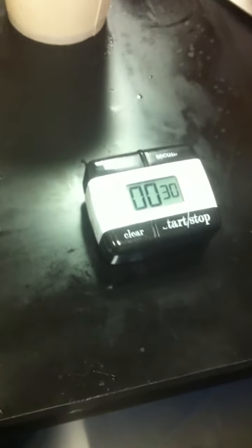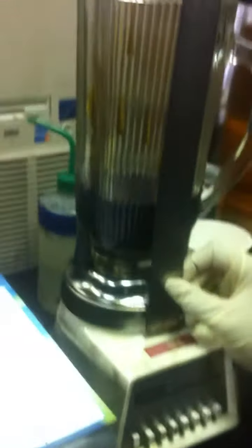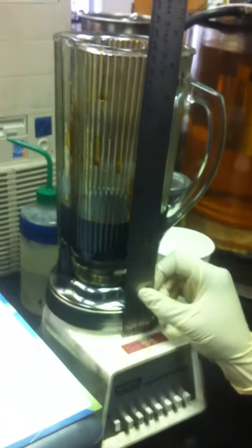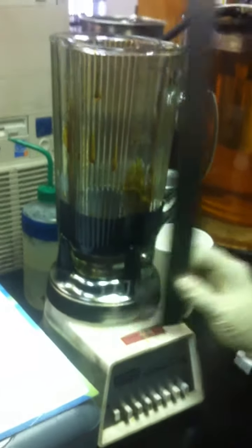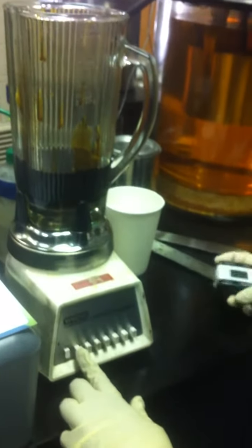This is the regular foam test. It's run for 30 seconds — there's the timer. Have you already run it on this oil, Deshaunna? No, not the 30 seconds. This is the starting point. I have to take the measurement before I run it. So 11.1, and then run it, speed 1, for 30 seconds.